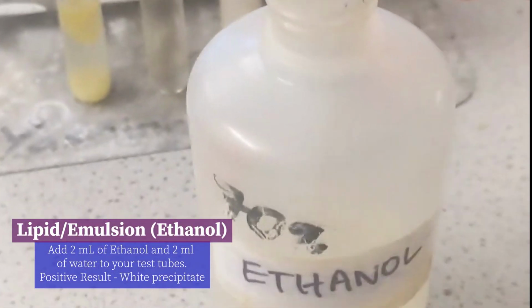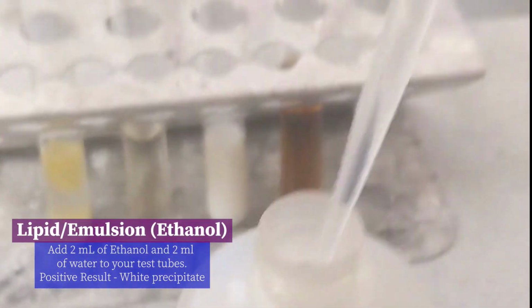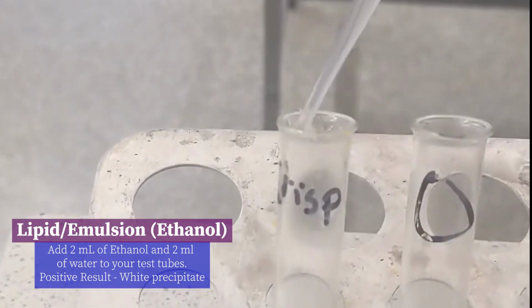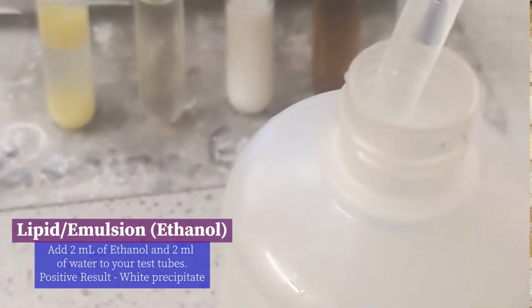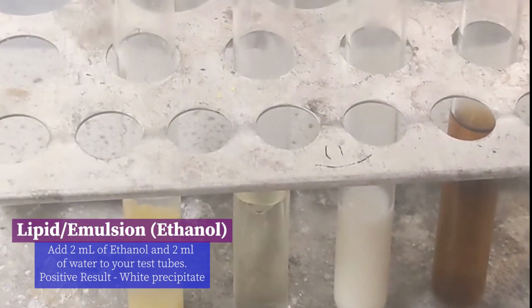Now, for this one, the way that I remember this one is lipids. A lot of people think of it as fats. Ethanol is a type of alcohol. So if I were to drink too much alcohol, I would start to gain extra fat. Alcohol, fat, ethanol, ethanol and lipids. They go together. Now, ethanol starts as a clear solution. I add it to my solution here.